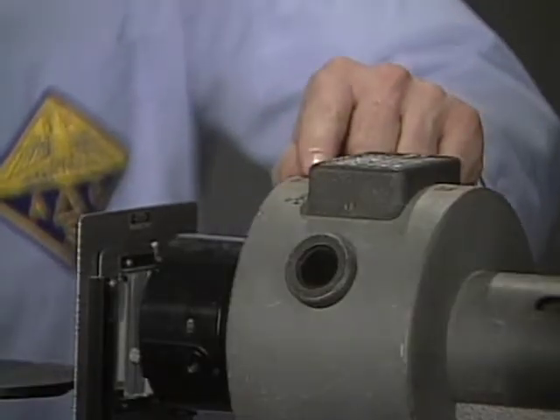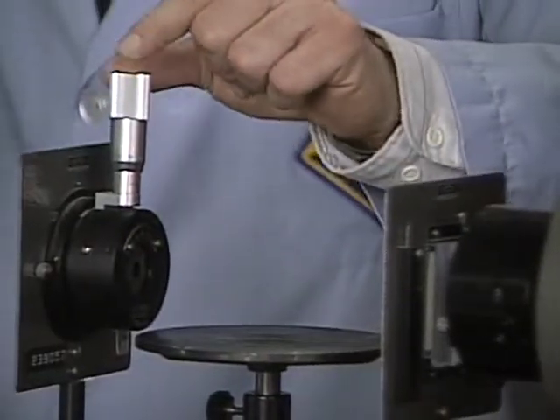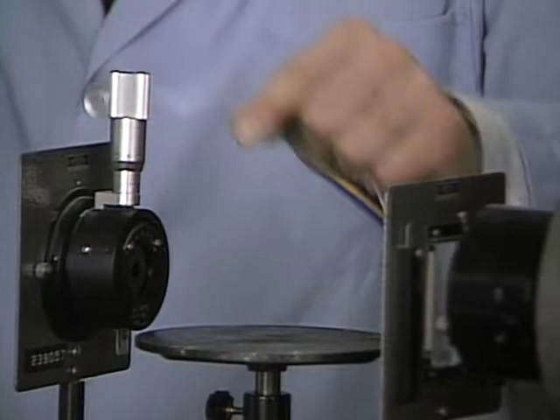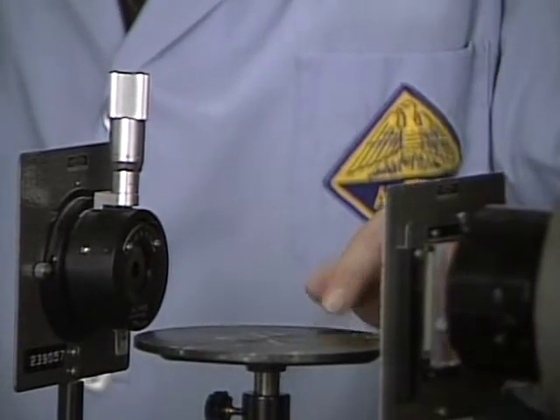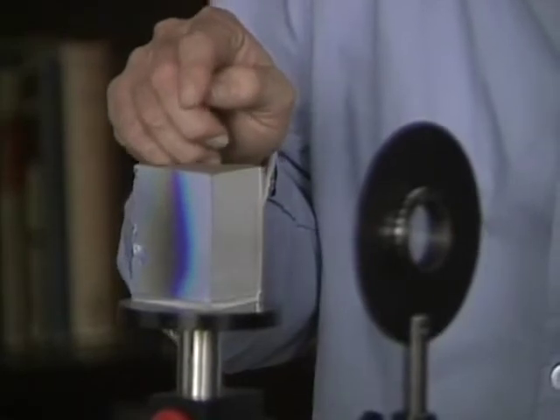Don Showalter: Here's a simple spectroscope that works in the visible light region. It has a light source, two focusing lenses, a slit for narrowing down the light beam, a stage for putting the sample on, and a prism. Now, the prism will break up the light into the colors of the spectrum and project it on the screen.